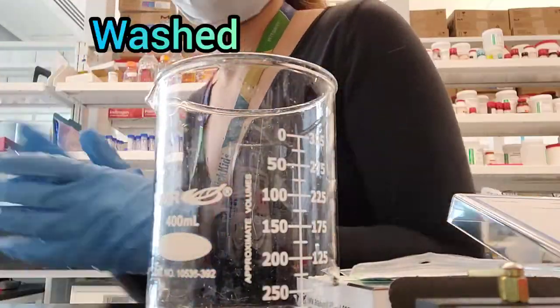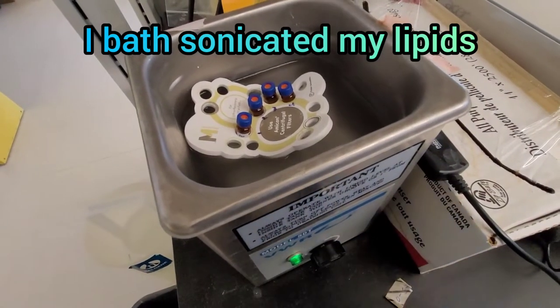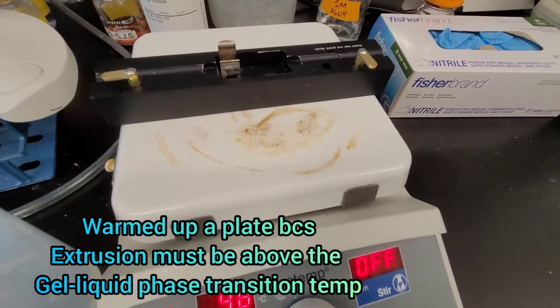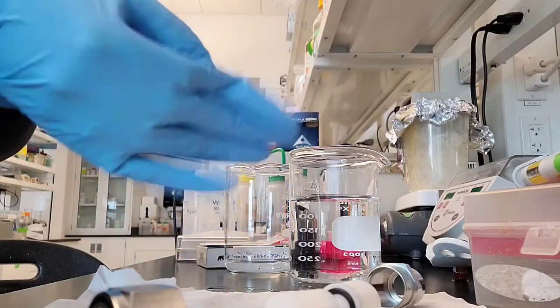Just before doing that, I make sure my lipids are really mixed well. I bath sonicate them a little bit and also warm up a plate.